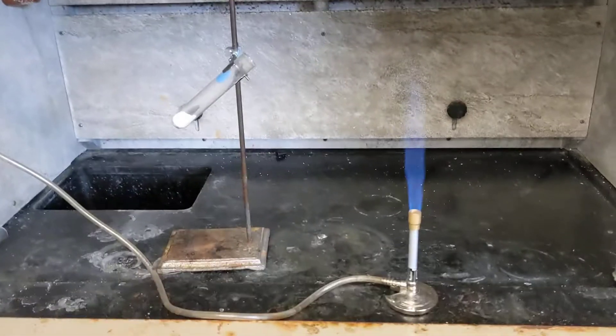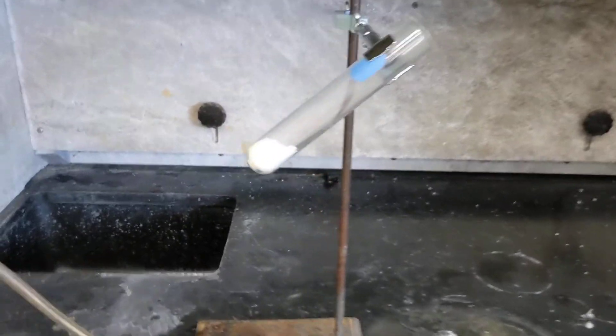Alright, I came to the school, so I'm standing in the lab. I've got some gummy bears. I've got some potassium chlorate in the test tube.